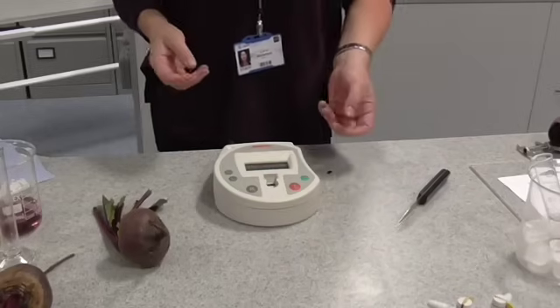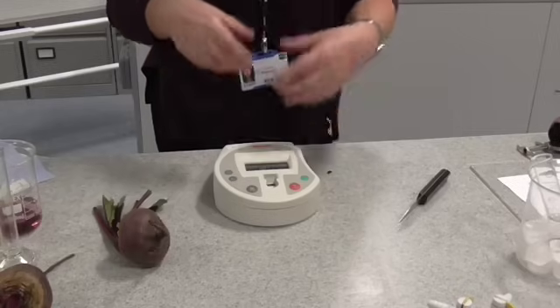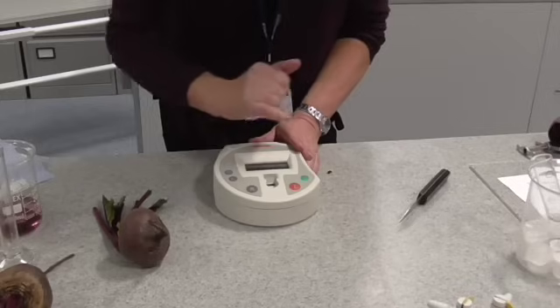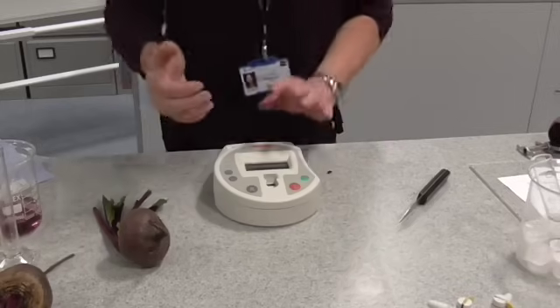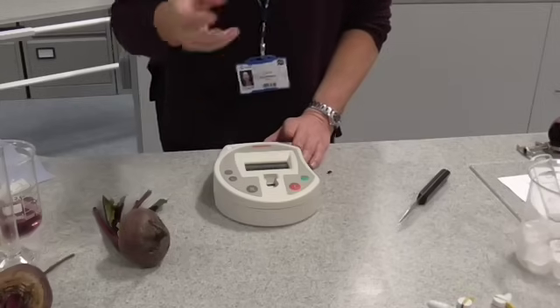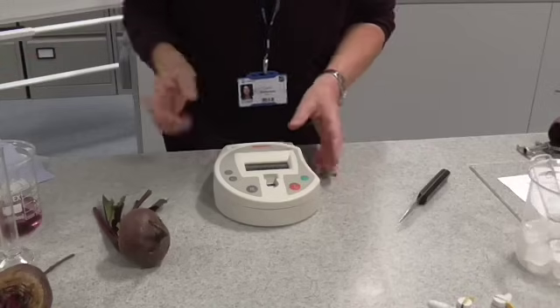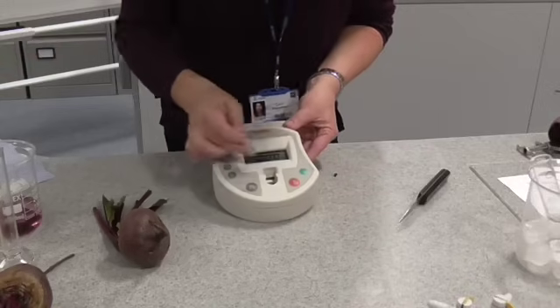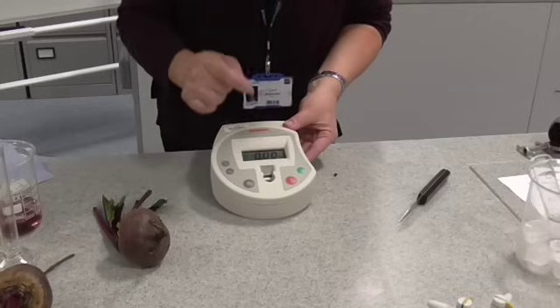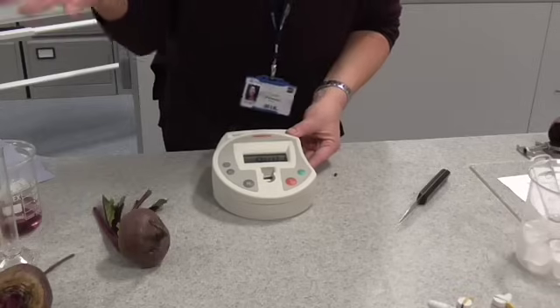A colorimeter is a device that measures the amount of coloured compound in a solution. It shines a light — and you can choose the colour — through a solution, and it works out how much of the light is either absorbed or transmitted. Because we're using a purpley-red pigment, we're actually going to shine a green light through it. I've set this at the green filter, and we're going to see how much green light is absorbed by the water that was kept at different temperatures.